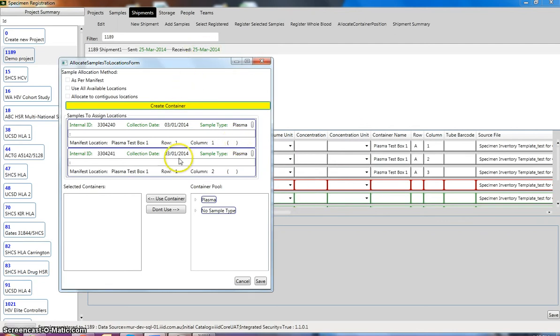Once that has been created, you just have to go under here, under container pool, or we can click on as per manifest, which is the other option as well. So if I click on as per manifest and then click save, it should register our samples into these containers.